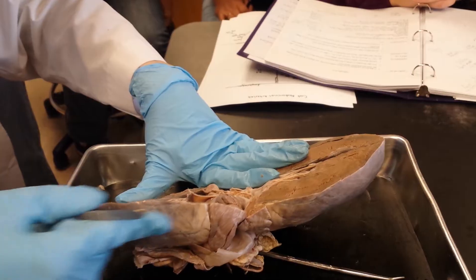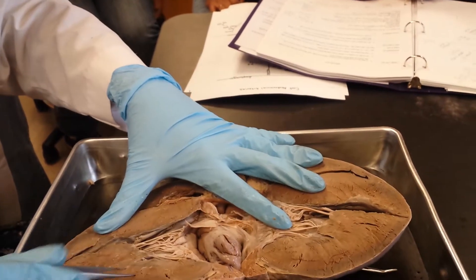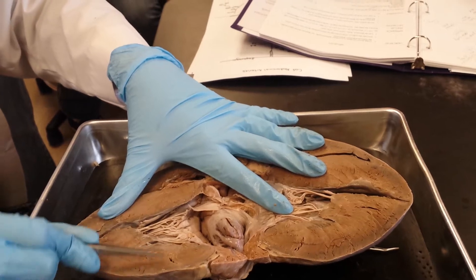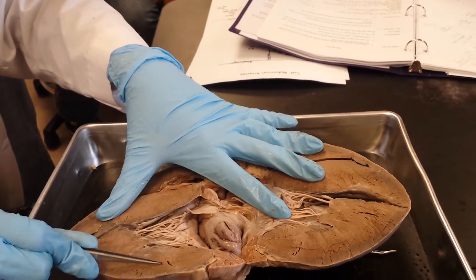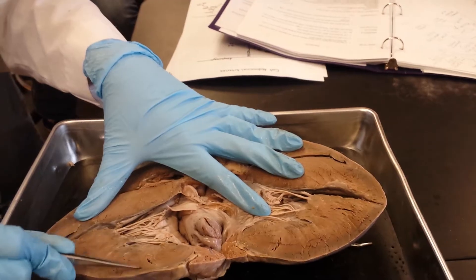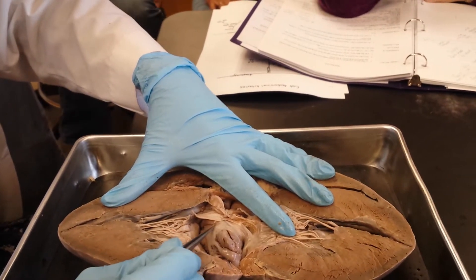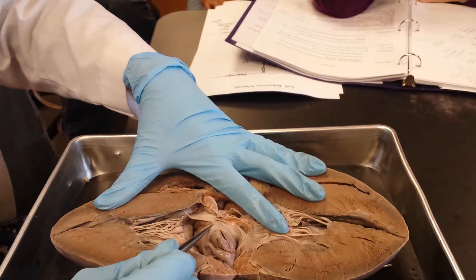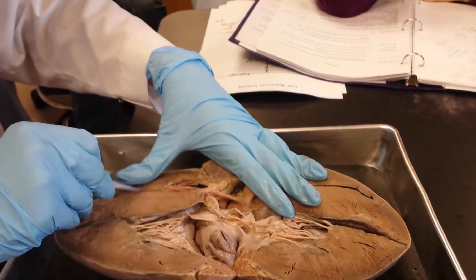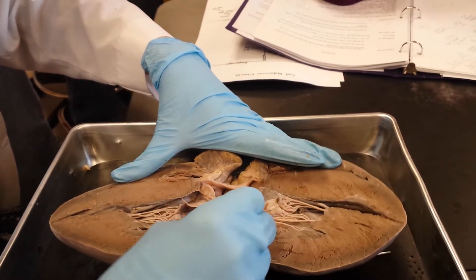We have the epicardium on the outside — a very thin translucent membrane. The majority of the heart wall is the myocardium. Myo means muscle, so this is myocardium. This shiny inner membrane is the endocardium — endo meaning within. That's the endocardium you find lining the ventricles and the atria.